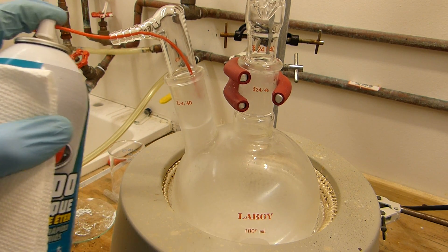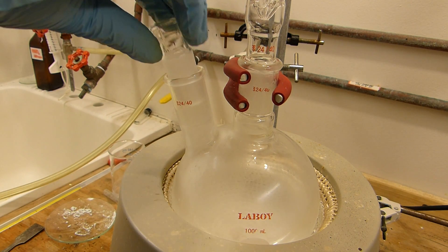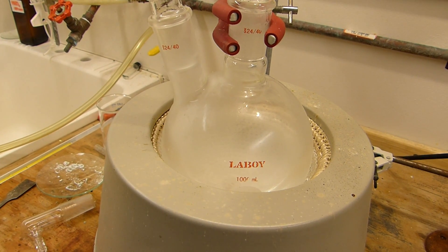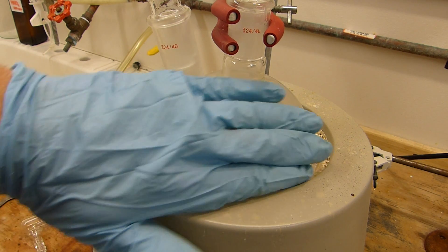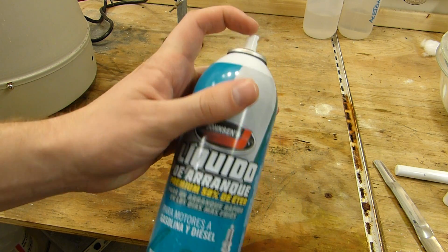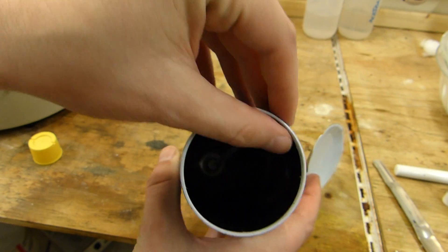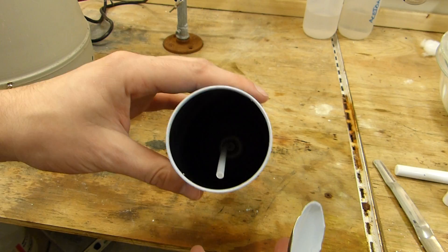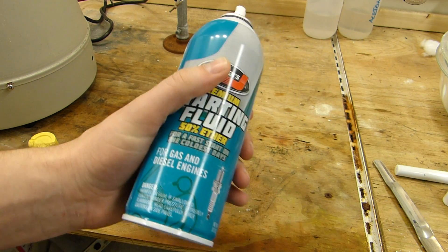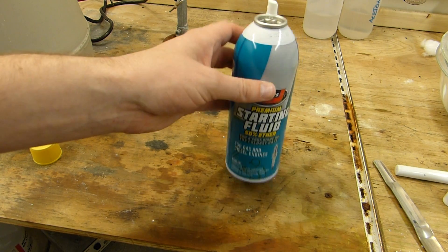I'm now going to replace the gas adapter with a stopper and allow this to acclimate to room temperature — that should remove the propellant and leave us with just a mixture of the heavier-boiling components. While waiting, I did an interesting experiment: I used a can opener to take the bottom off an empty can, and there's just a clean, dry, empty straw in there. It's a pretty thick steel can due to the CO₂ propellant — higher pressure than a regular aerosol — so you could use it as a safe of sorts.